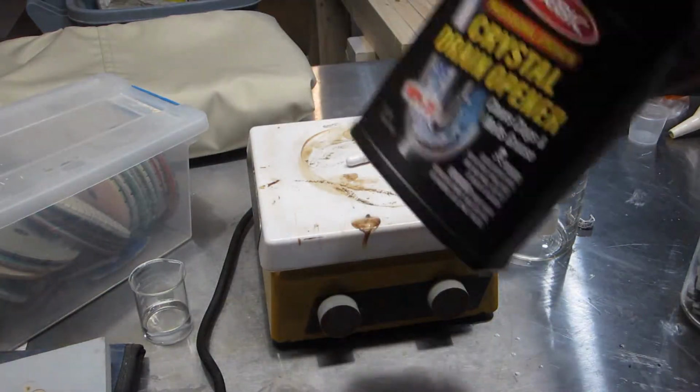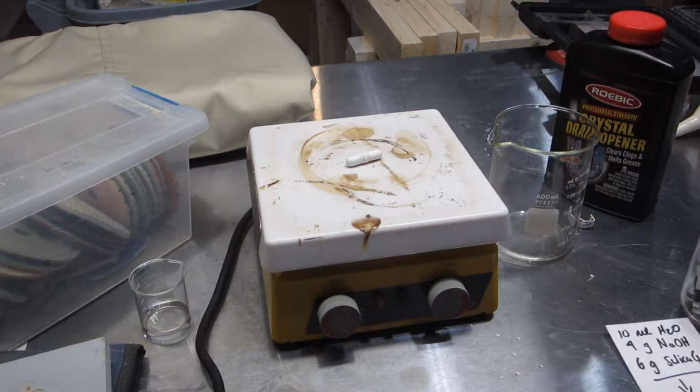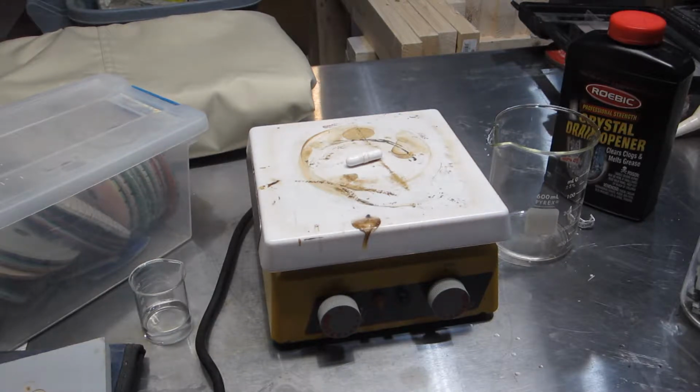sodium hydroxide. This reaction is all over the internet on YouTube. You can find people doing this everywhere. I'm hoping that I can use this for something else, and that'll be a surprise. So stay tuned to see what I'm going to do with it. In the meantime, let's just go through the motions here and hopefully make some. It shouldn't be too difficult.